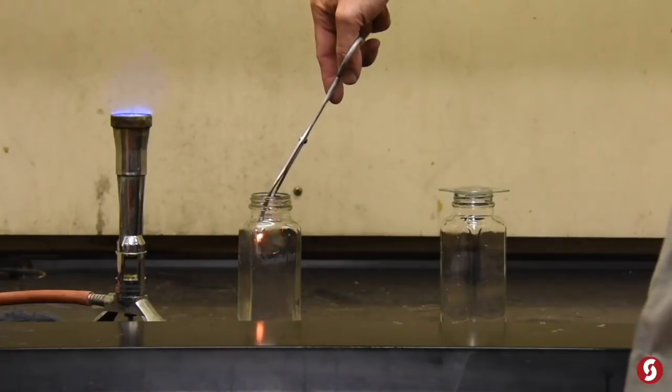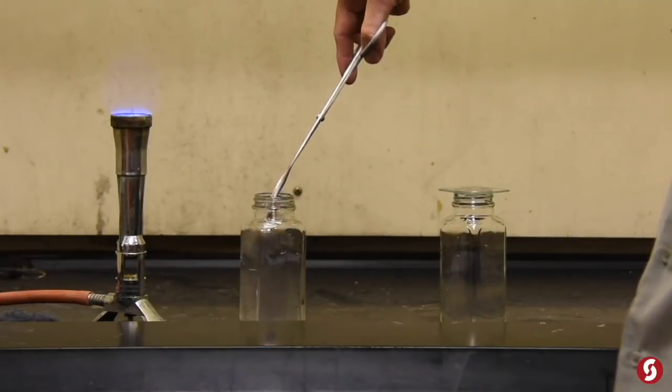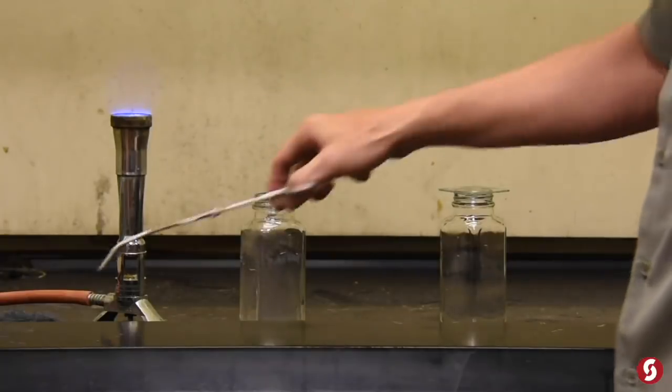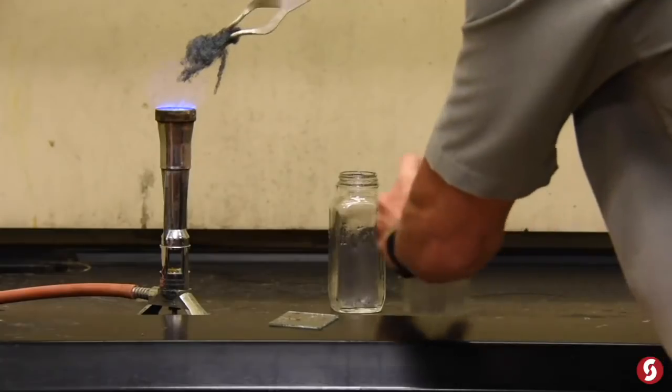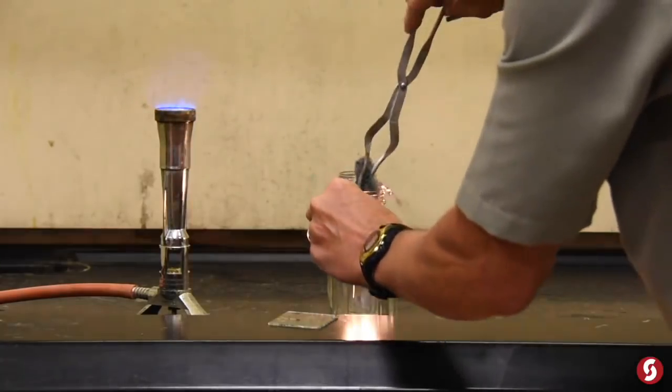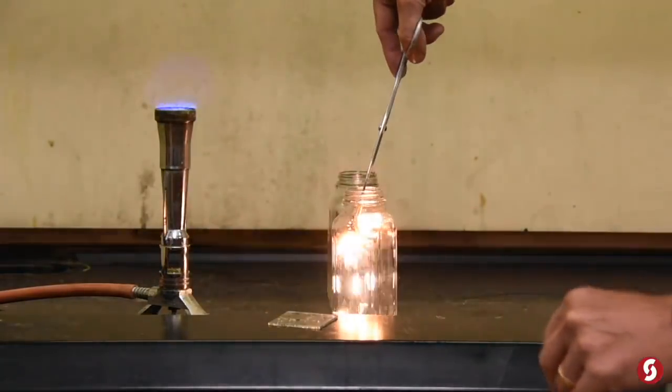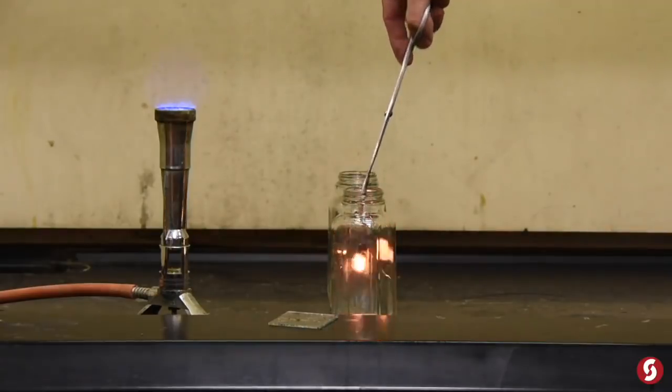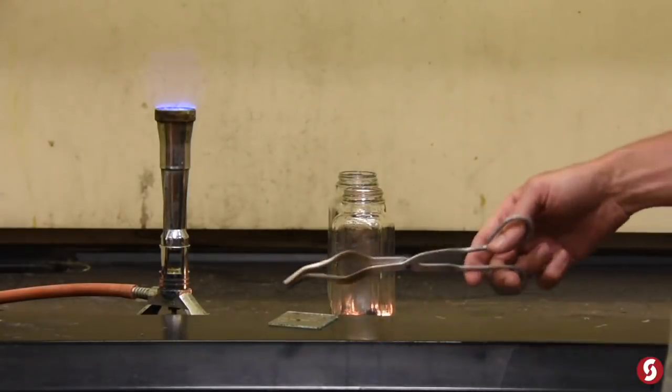There you go. And that's the power of the pure oxygen environment right there. Let's try that again. Looks like a sparkler. Good stuff.